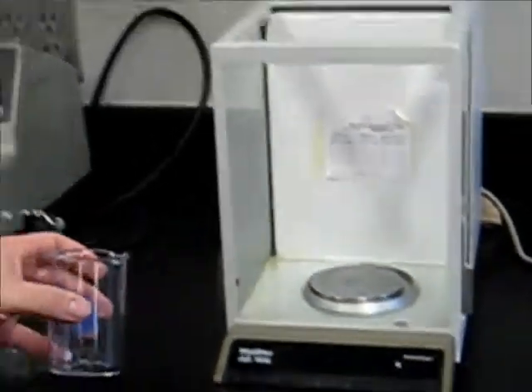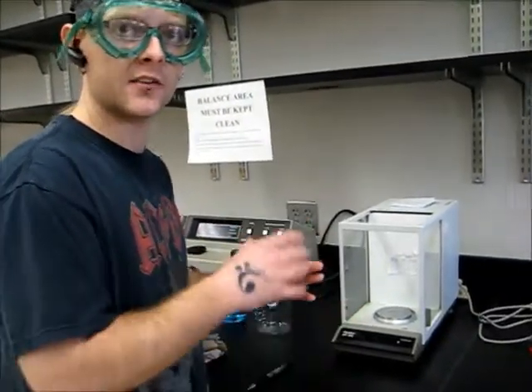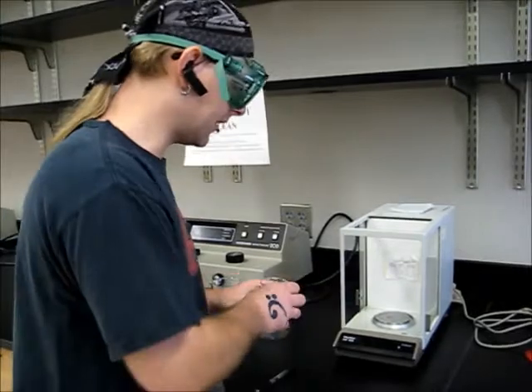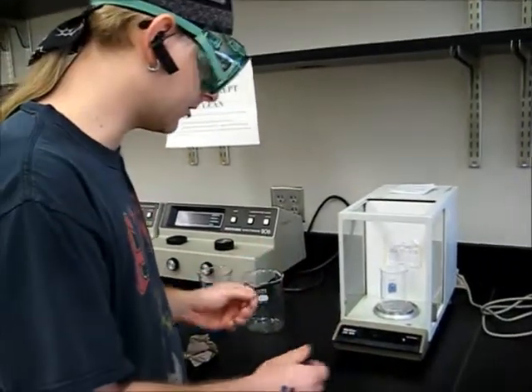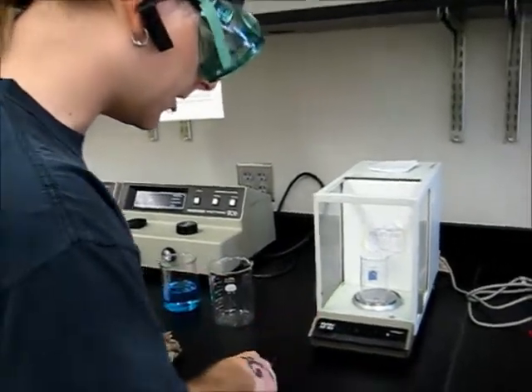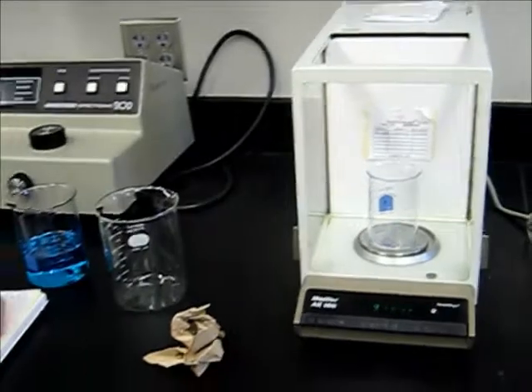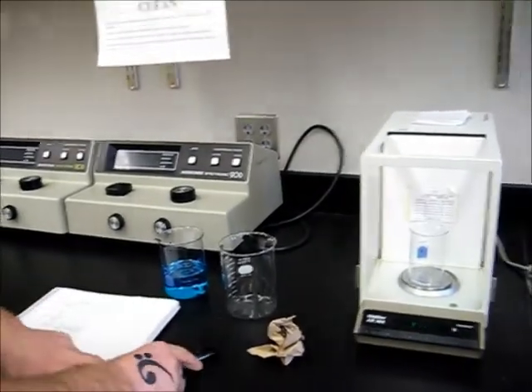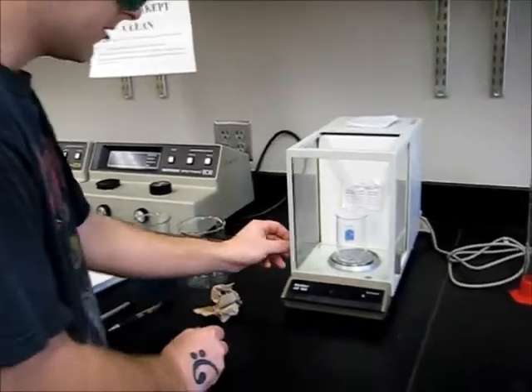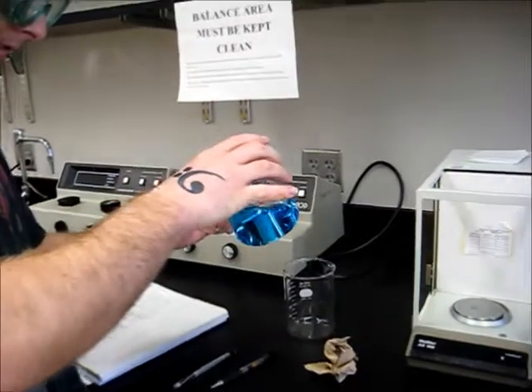Like so. Now, you want to take a measurement of your beaker as it's empty and clean. This way you can subtract that from your total weight when you add the solution to it later. This allows for more accurate collection of data when you get your solution in the beaker. This particular beaker is 91.59, so you want to record that in grams, 91.59.